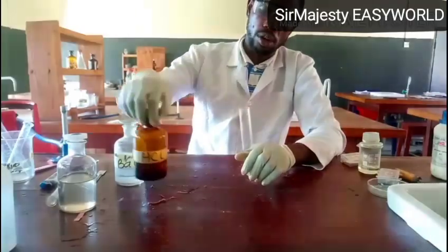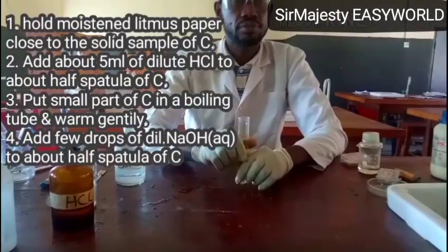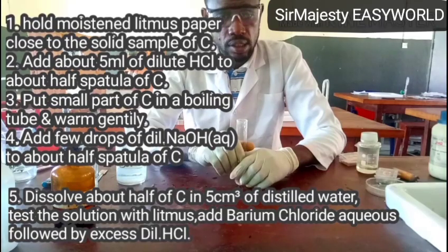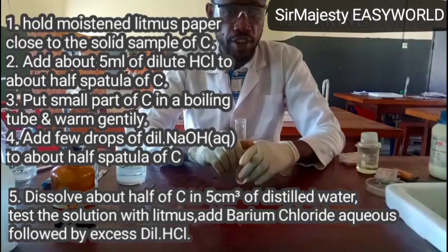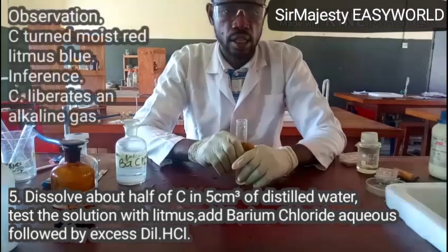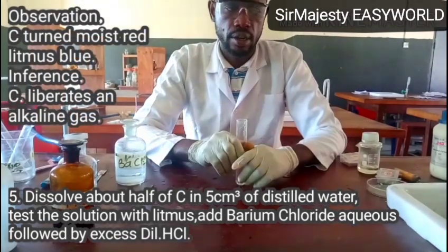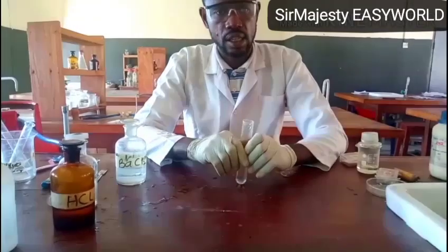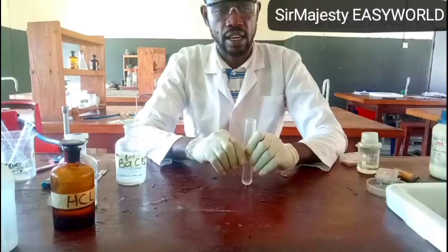Now, let me construct the question for you. You can see there on the screen. The first one is that you might be required to moisten litmus paper and hold it very close to sample C. Our observation is that it turns moist red litmus paper blue, and that shows that sample C liberates an alkaline gas.